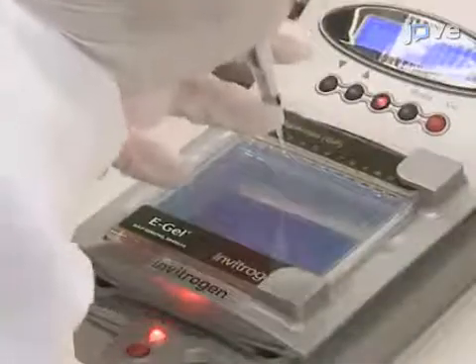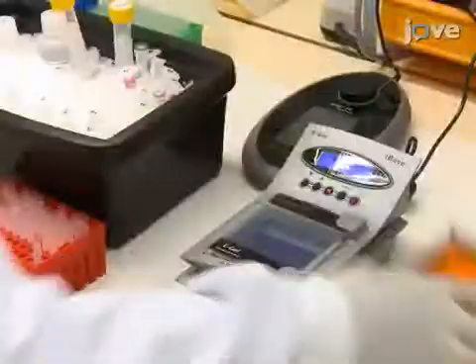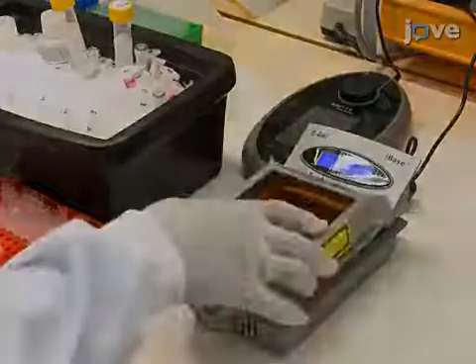Check the sonication range for all samples using DNA electrophoresis as described in the text protocol.